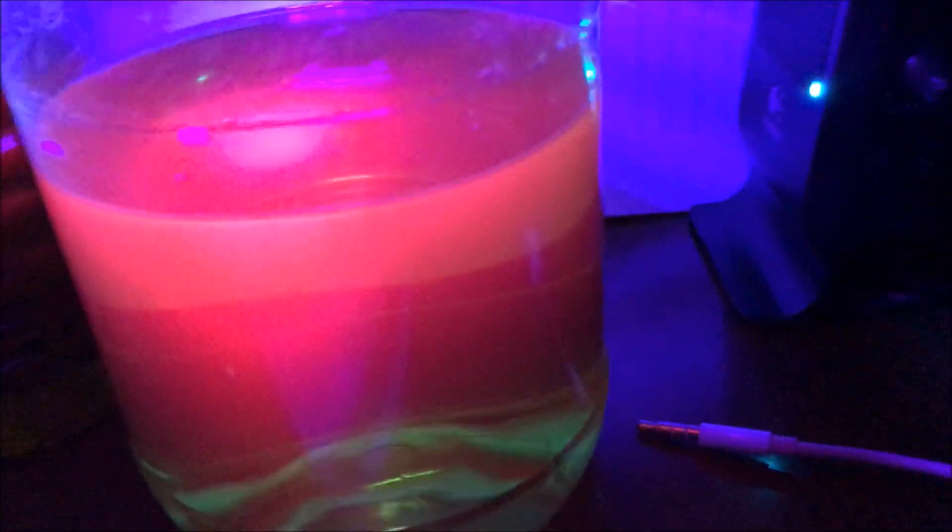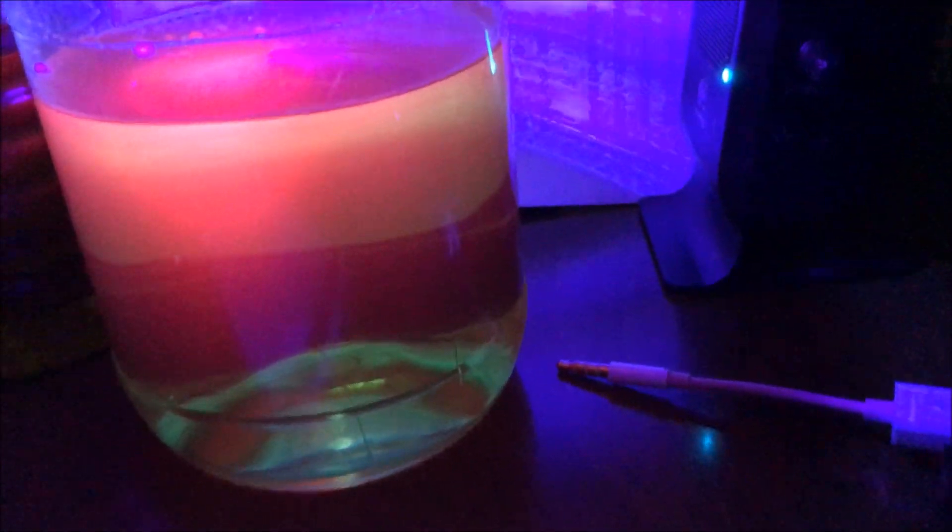From right above. The color is more beautiful in real life, in my opinion. It's a little bit oranger in there. So you really have to see it. It's an easy thing to do.